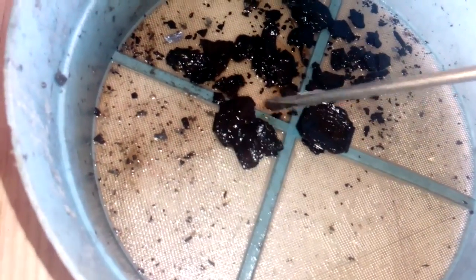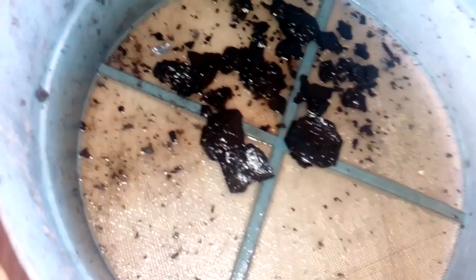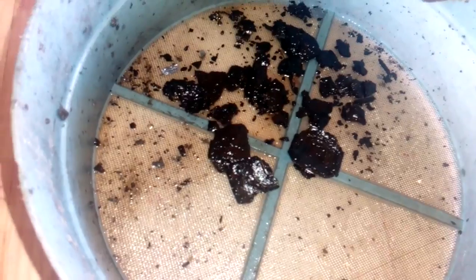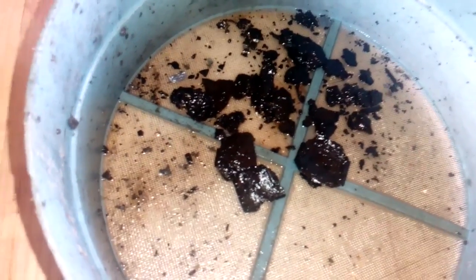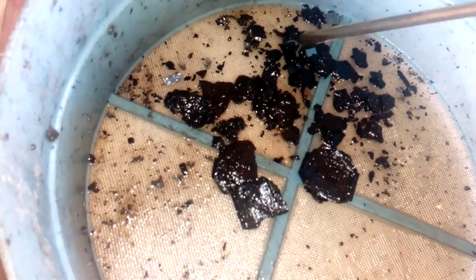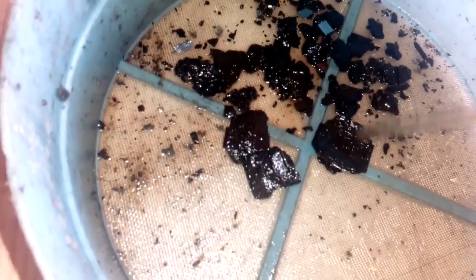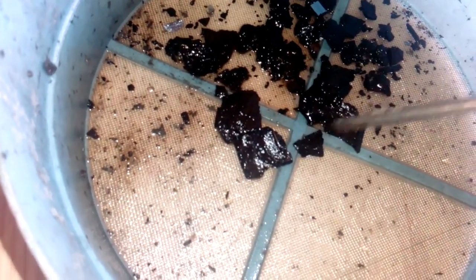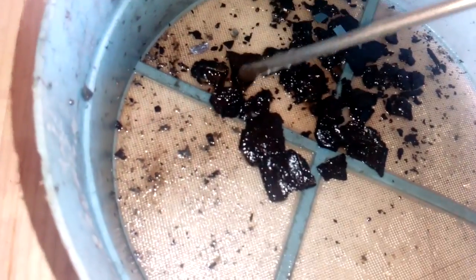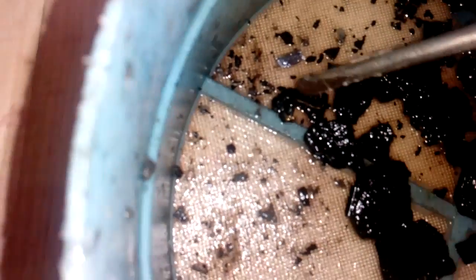The stuff is not totally dissolved because that acid is not strong enough. Even when I slowly evaporated all the liquid from one liter down to only 400 ml and put only five chips inside, that stuff is not powerful enough to dissolve this plastic. Here - gold bonding wire.